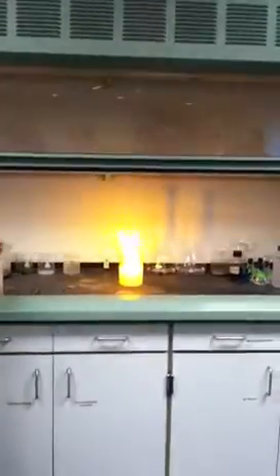That's enough, that's enough. That's enough! They should perhaps get out of the way. You should perhaps get out of the way. Aiko, watch out! Look at that! Look at that! That's scary!